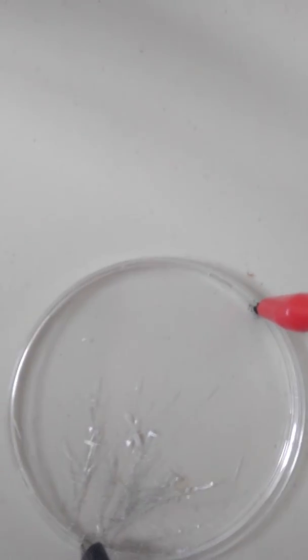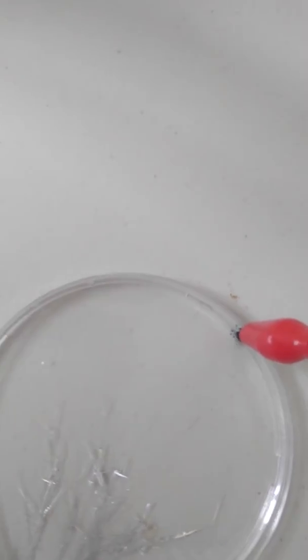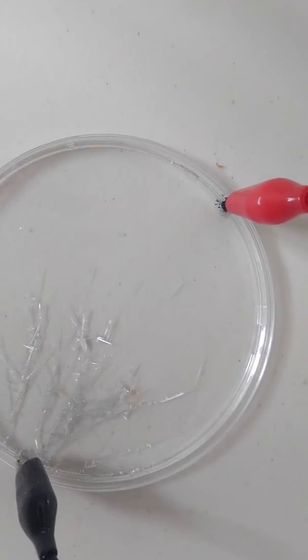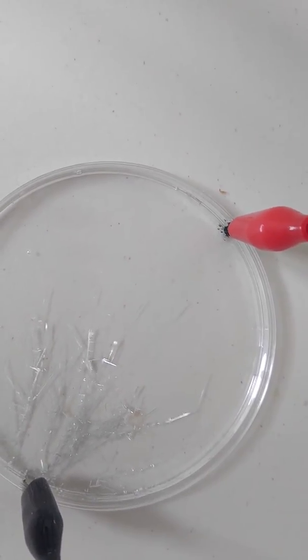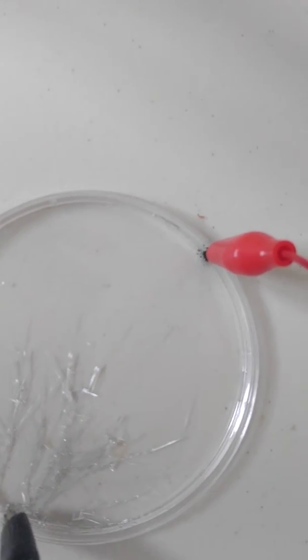No, it hasn't stopped. They're going all the way to the other side. I don't know if it goes all the way to the other side, but it will keep growing for a while. I think it eventually starts to grow up. It will eventually ruin the clips, but if you want to come back in like 10 minutes and see what it looks like, you can. Or you can keep on watching.